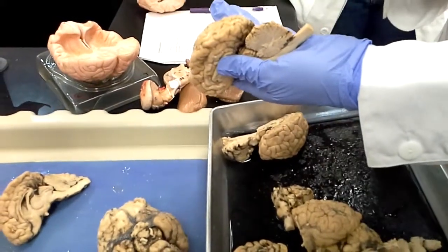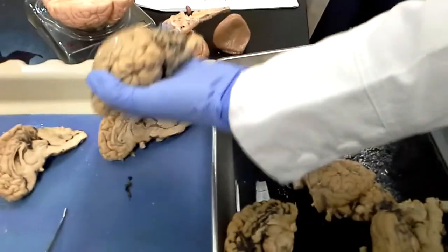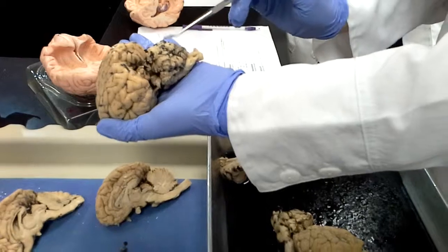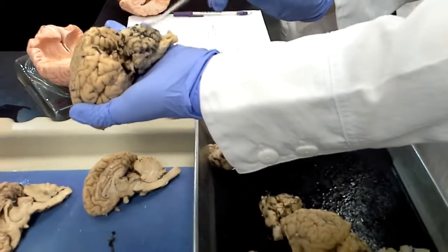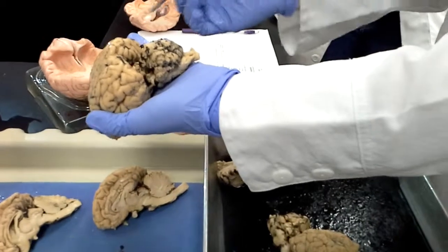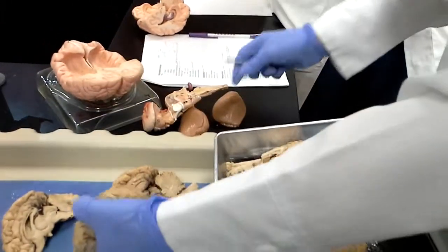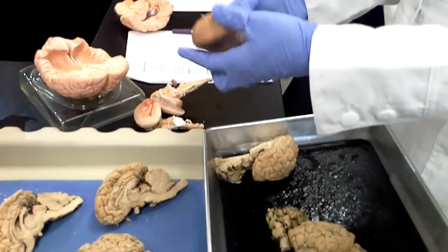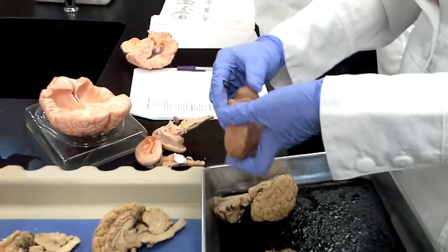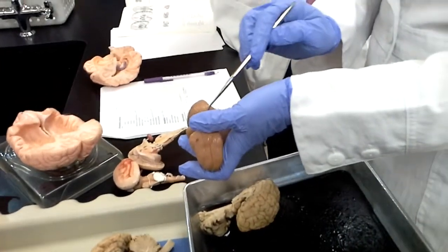So almost like the gyri, but they're a little bit more delicate, small. So folia. And then the vermis is the name we use to describe that middle piece, separating the 2 halves of the cerebellum. So vermis on these brains sort of sticks out a little bit, that prominent ridge. On this human model, you can see it as that middle piece. So that's vermis.